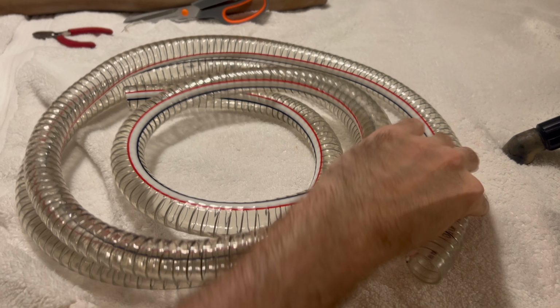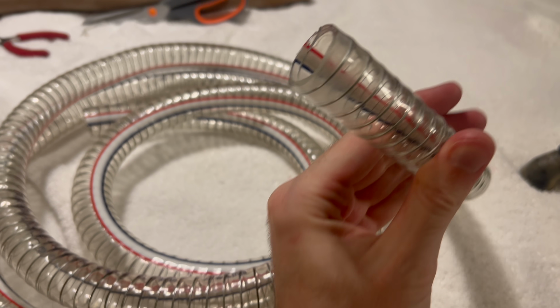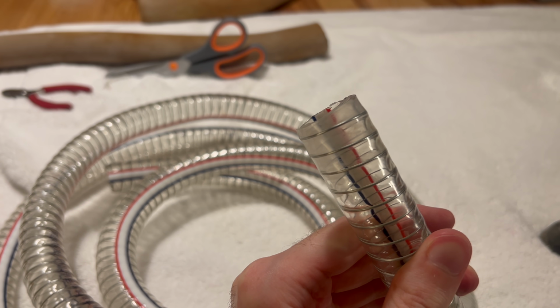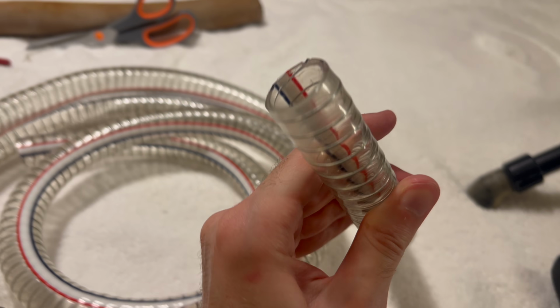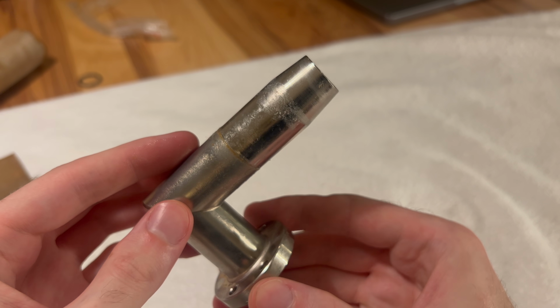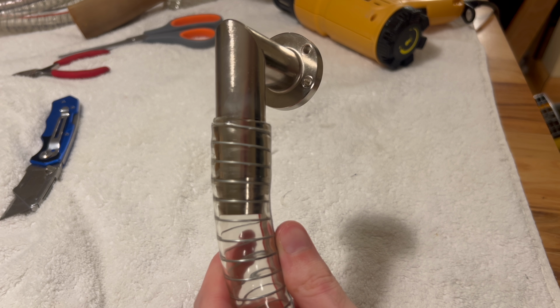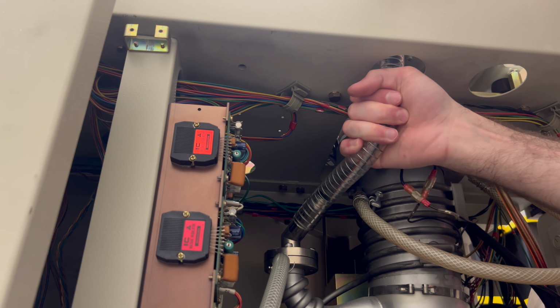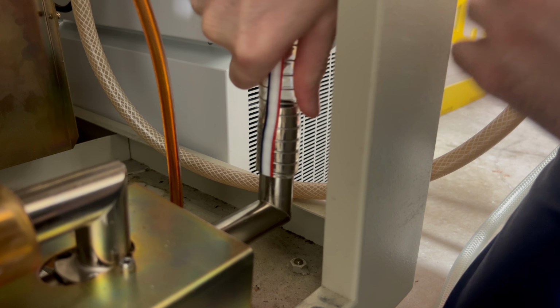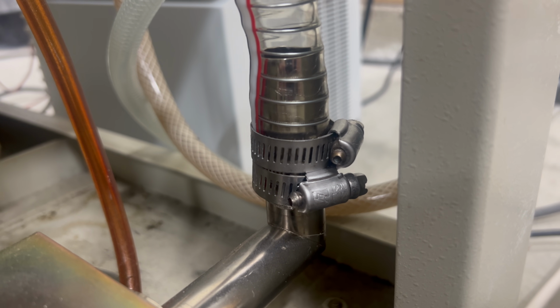Fortunately, I was able to find this 7/8 inch, about 22 millimeter, PVC hose reinforced with a steel coil. This keeps it from collapsing under vacuum, but it also might keep the 22 millimeter hose from stretching over the larger 24 millimeter fitting. Only one way to find out. After some persuasion, I was able to make it work just fine. Thank goodness. I replaced all of the rubber hoses and made sure to grease the joints with high vacuum grease, and also used hose clamps to ensure a good seal.